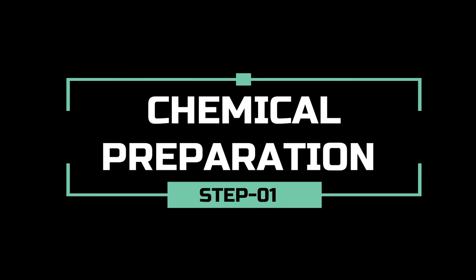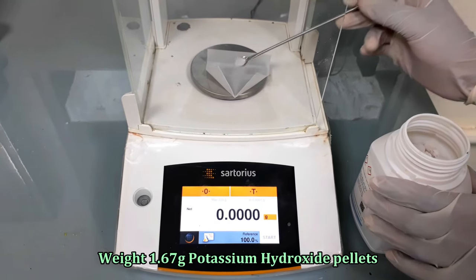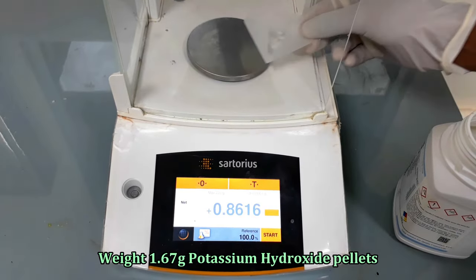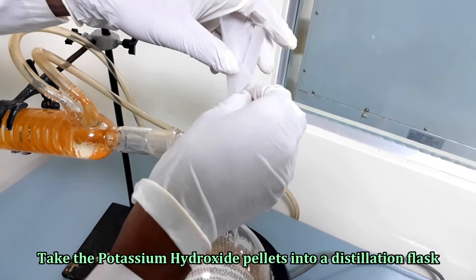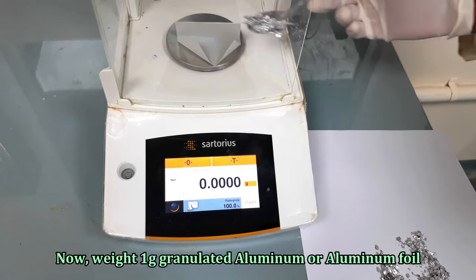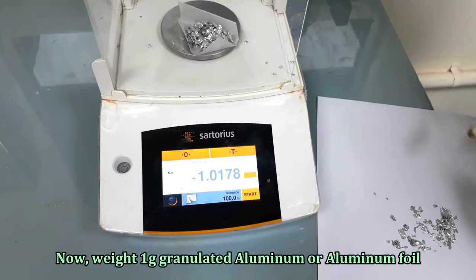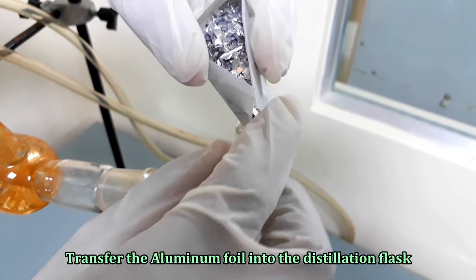Let's start the analysis. In this step, we will prepare chemicals and reagents. At first, we will prepare 4% ethanolic potassium hydroxide solution with 1.67 grams potassium hydroxide pellets and take into a round bottom distillation flask. Now, with 1 gram granulated aluminum foil, transfer the aluminum foil into the same flask.